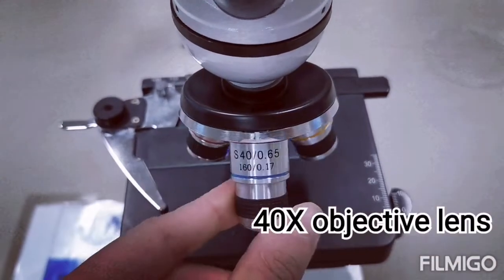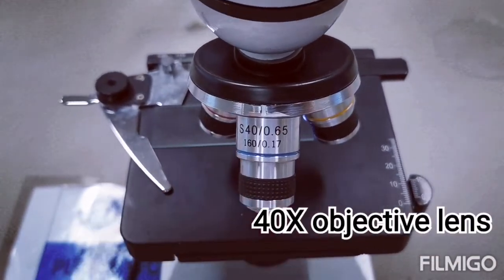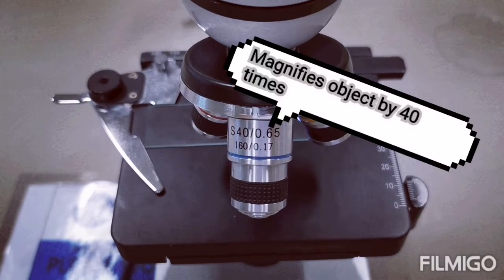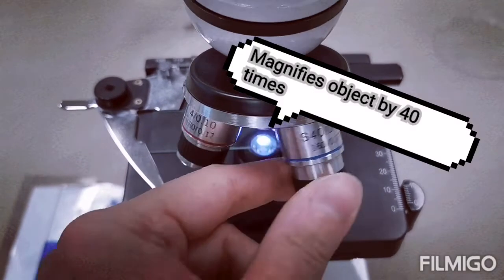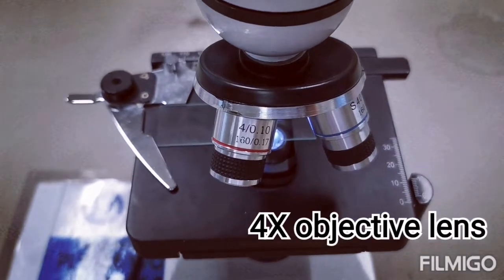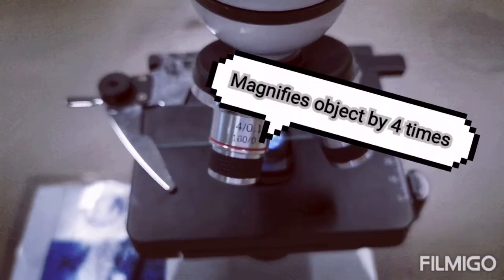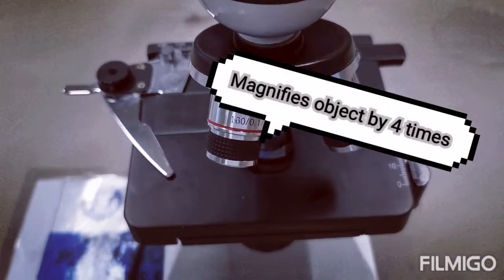We have the high power objective lens, which is the 40 times objective lens that magnifies the object by 40 times. And lastly, we have the low power objective lens, or the 4 times objective lens, that magnifies the object by 4 times.